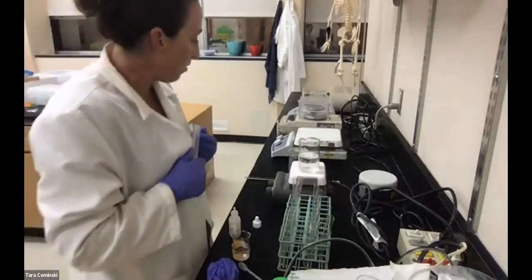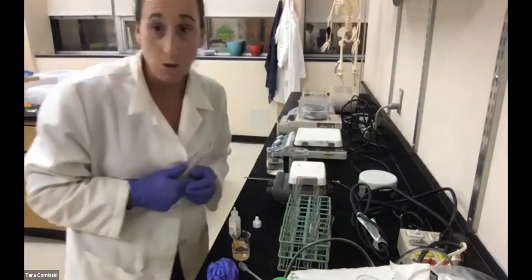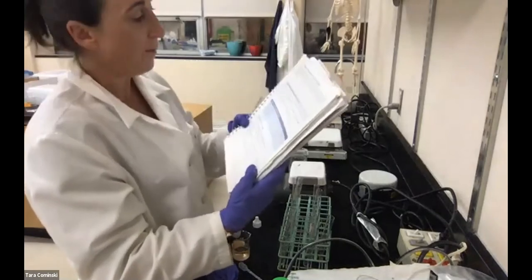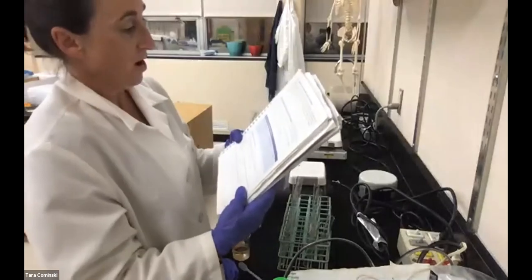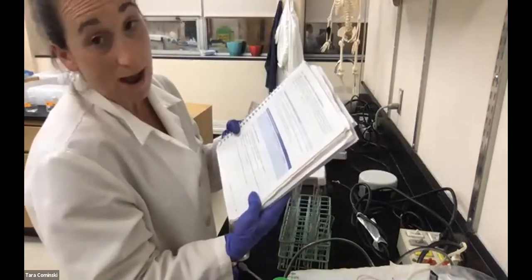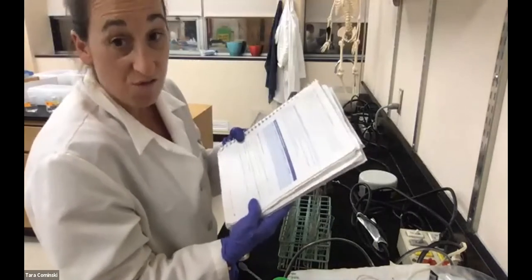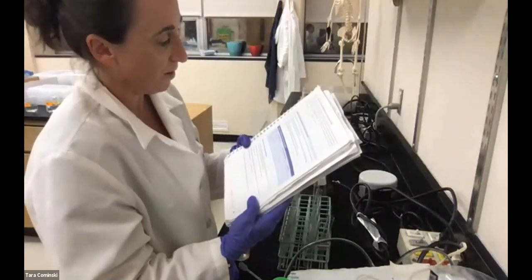All right, now let me shut this guy off too. That brings us to our next experiment, on page 61, which is the effect of concentration on enzyme activity. Again, we have tubes 1, 2, 3. In tube 1, there is no enzyme. In tube 2, there's 1 milliliter of enzyme, and in tube 3, there are 3 milliliters of enzyme. So we're changing the amount of the enzyme in each tube.